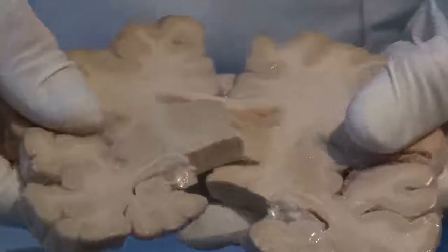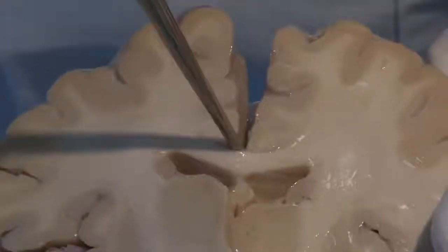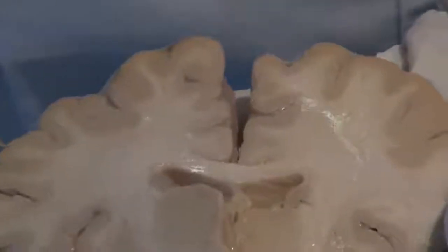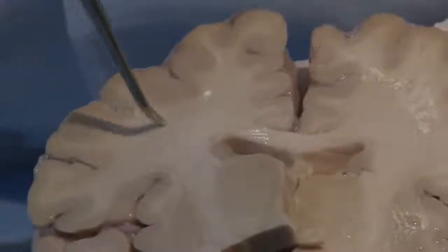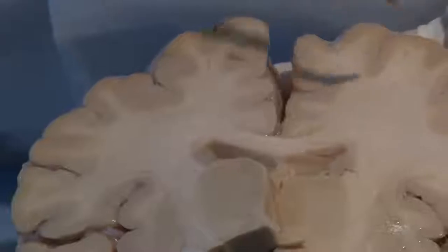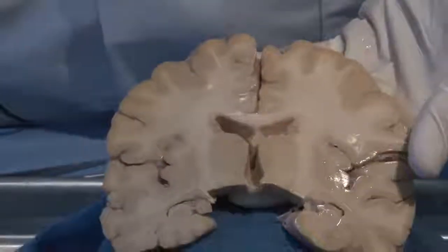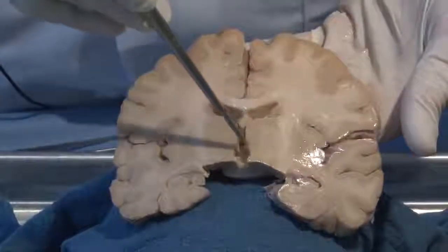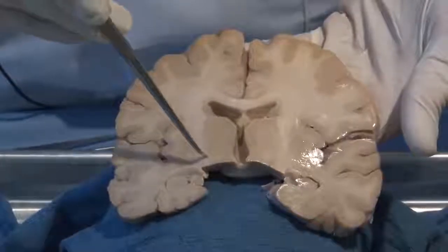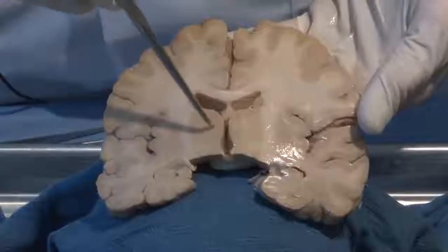It was that band that held the two hemispheres together. When we were looking down through that interhemispheric fissure, at the base of that was this band of white matter connecting similar areas, or homotopic areas, of one hemisphere with the other. And this is a way that the right and the left hemispheres can communicate. In addition, they can communicate through structures like this deep area. You notice it's beige, so it's mainly cell bodies. A deep structure called the thalamus.